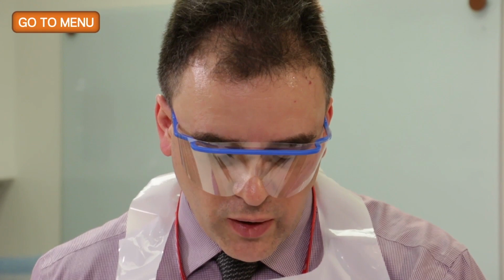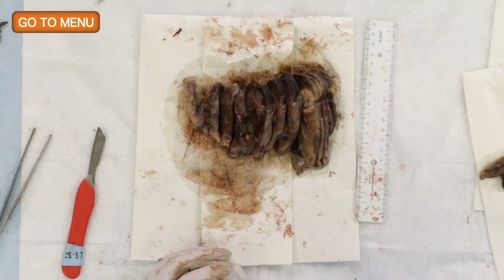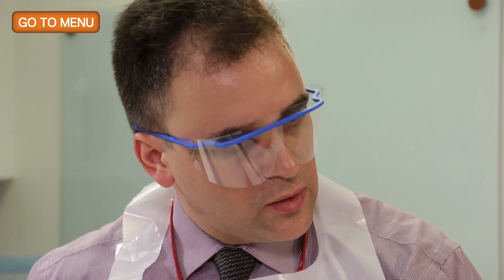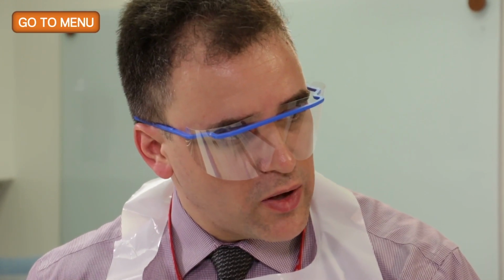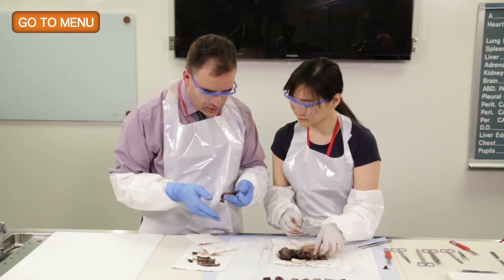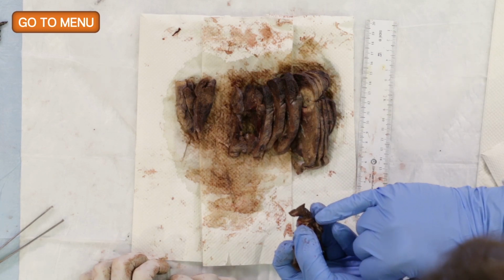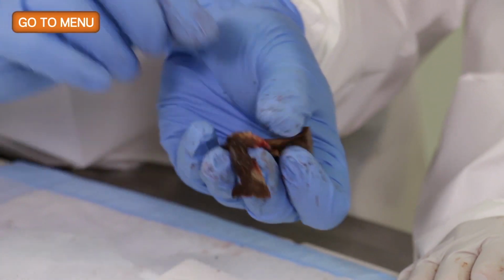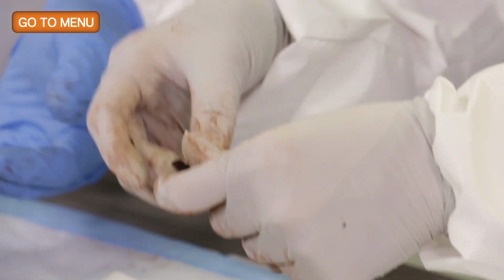What I would do is pick 2 areas of lung that were not near the 2 areas of hemorrhage, but perhaps closer to the tumor but not near the tumor in these slices, just to see a couple of different areas of lung. Okay. And at the same time, to look for lymph nodes just to make sure we haven't missed any. So let me just hand you this slice that we had looked at before. Okay. Because as we were talking, I did notice that there was just a tiny, maybe 2-3 millimeter lymph node right here near the airway. So we're going to take that one. Okay, so why don't you take the slice from me and take that section?